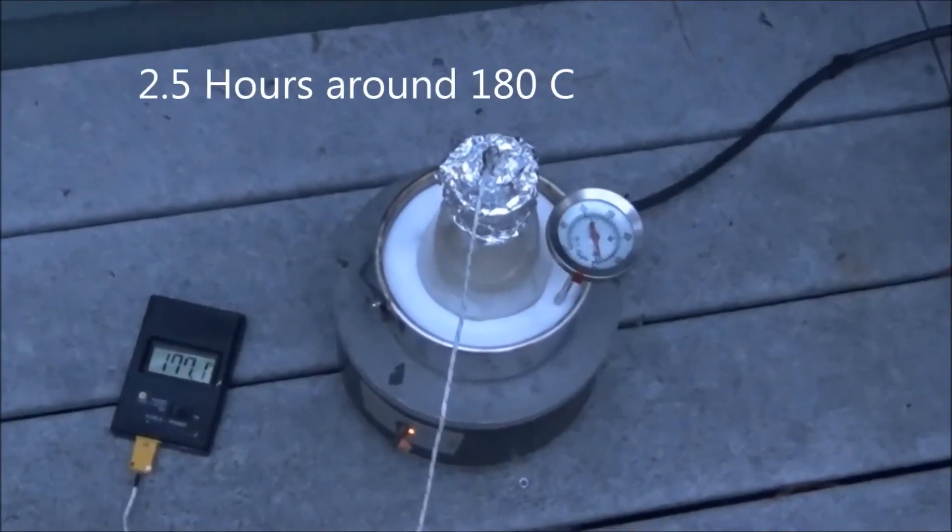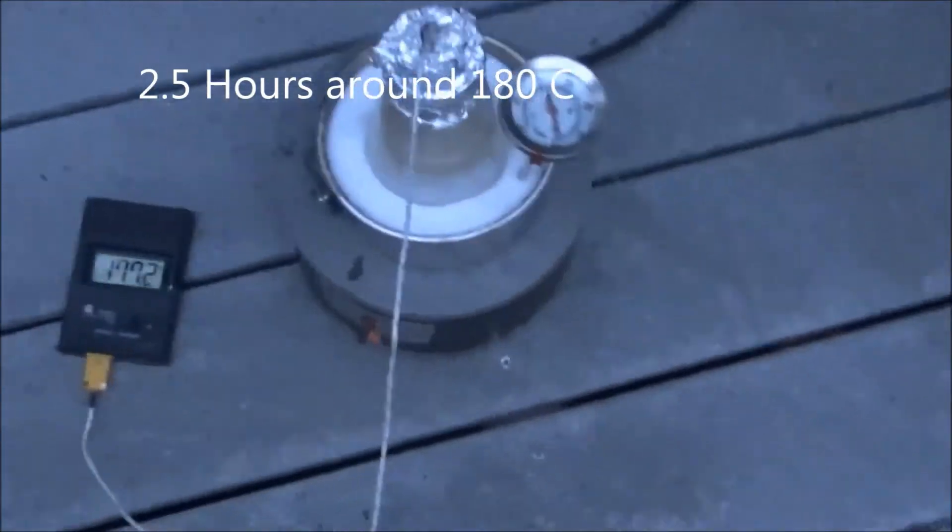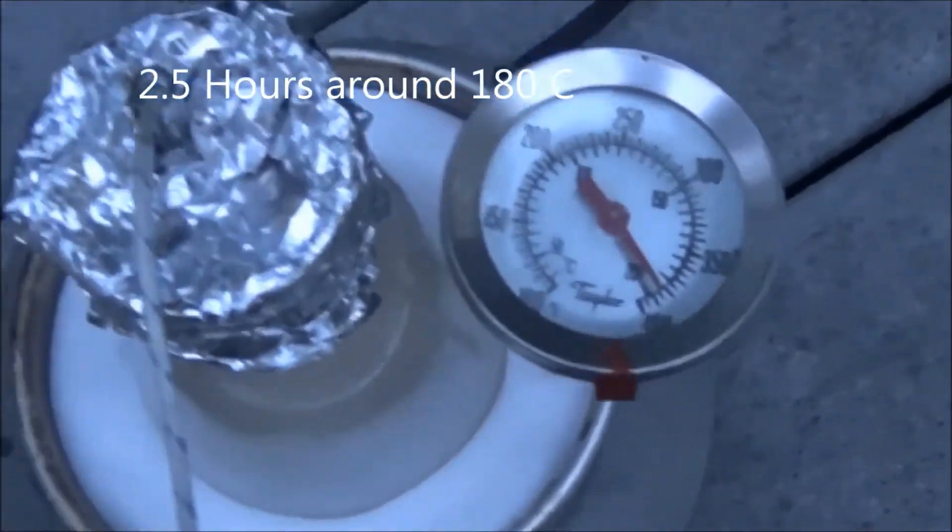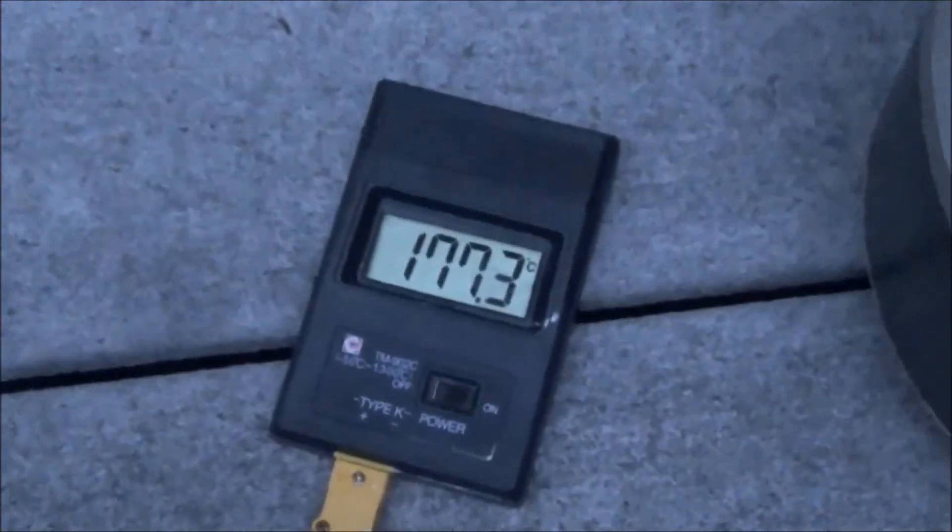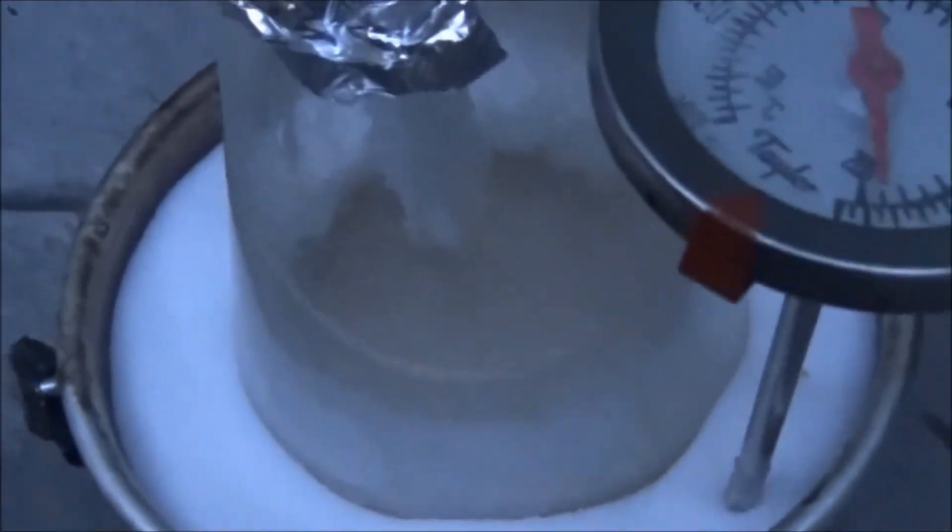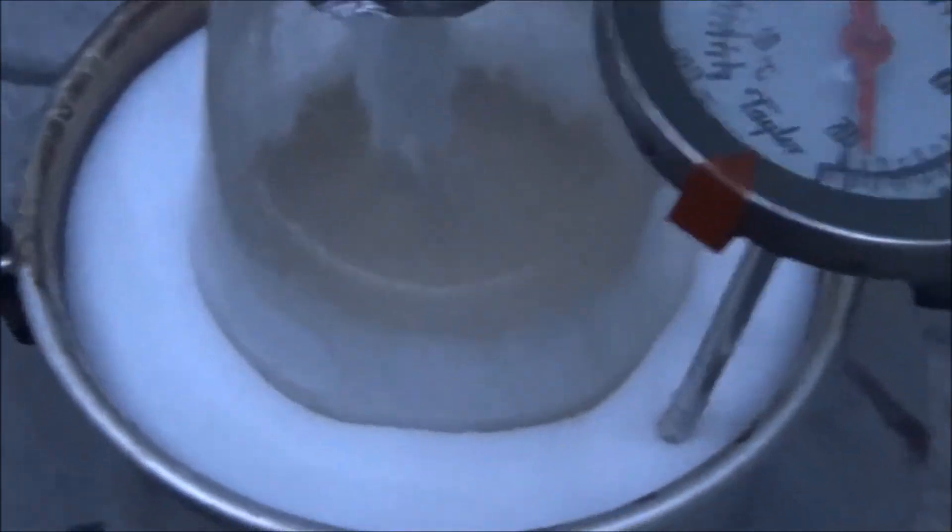Eventually, it reached about 180 degrees Celsius, and I adjusted the hot plate to try and keep it at this temperature. It should be kept around this temperature for about two and a half hours. Notice the solids inside, which will have to be knocked down periodically.